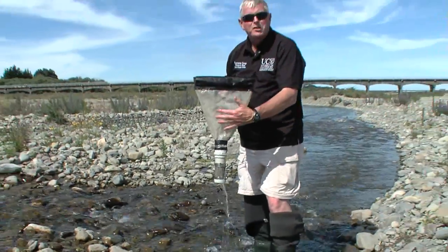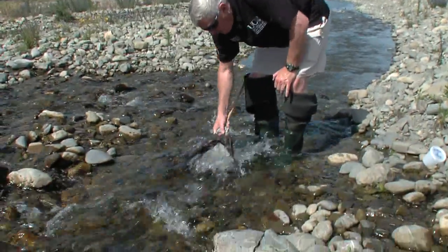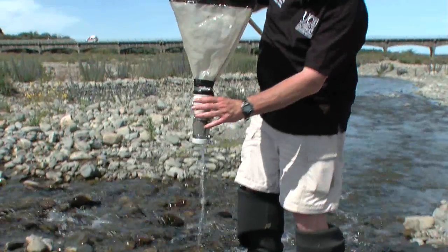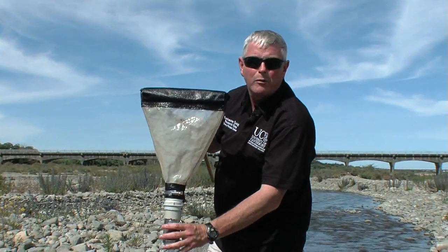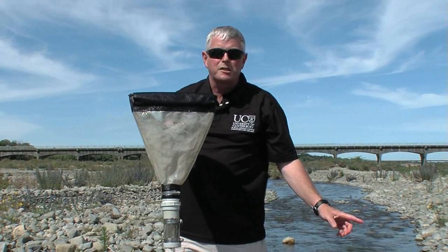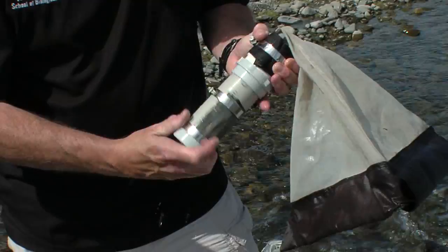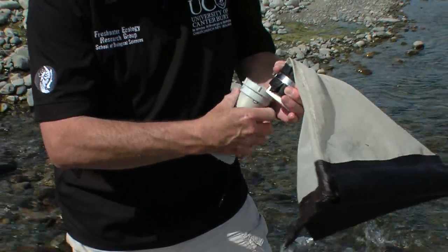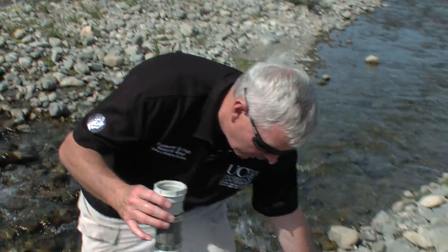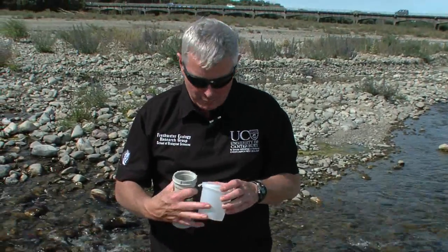Some of the invertebrates will be stuck to the side of this net, so I often need to flush it out several times to get them to come down into the bottom of the pottle, which I'm then going to transfer to a pottle to take back to the laboratory. To do that, I'm going to unwind the pottle here, which has got my sample in it, and transfer it to a pottle to take back to the laboratory.